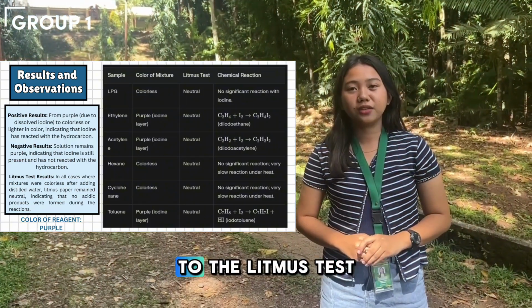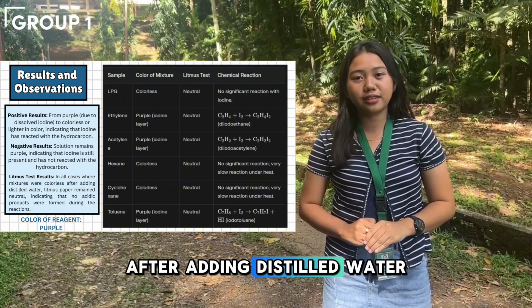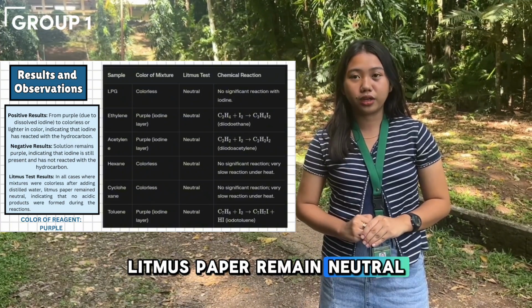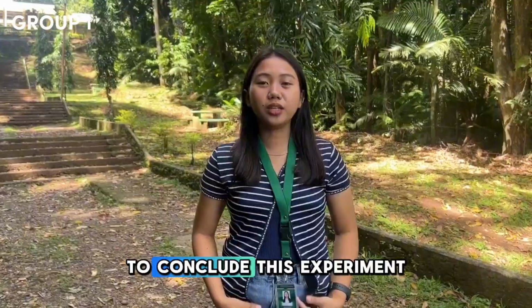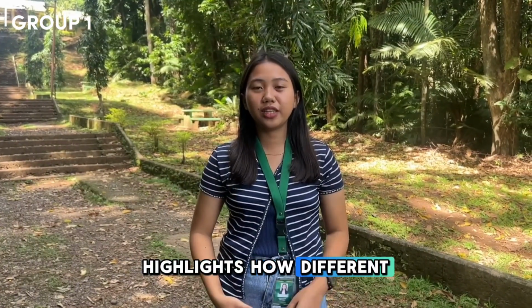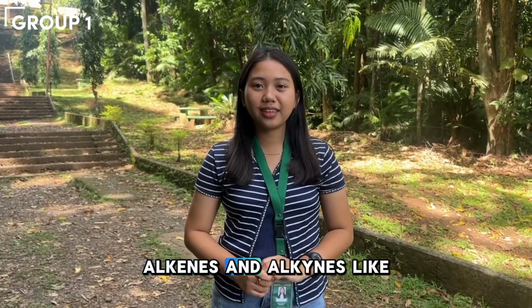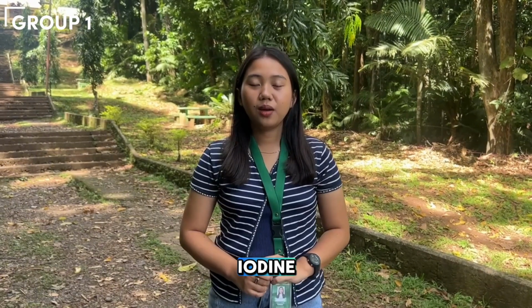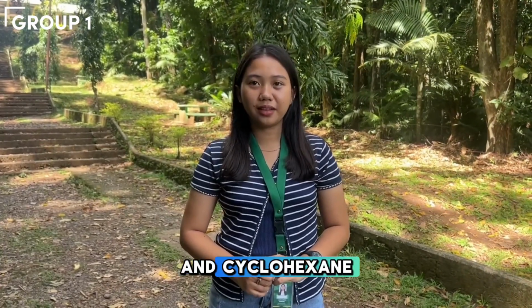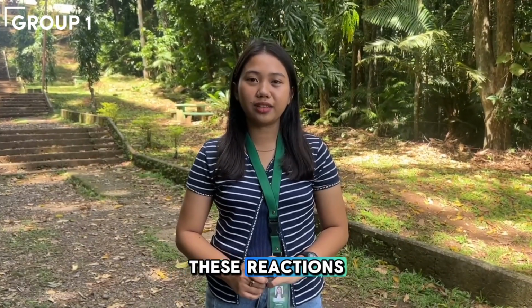Now, let us proceed to the litmus test results. In all cases where mixtures were colorless after adding distilled water, litmus paper remained neutral, indicating that no acidic products were formed during the reactions. To conclude, this experiment highlights how different hydrocarbons react with iodine under varying light conditions. Alkenes and alkynes, like ethylene and acetylene respectively, react readily with iodine, while alkanes, like hexane and cyclohexane, show little to no reactivity. The use of litmus paper confirms that no acidic byproducts are formed during these reactions.